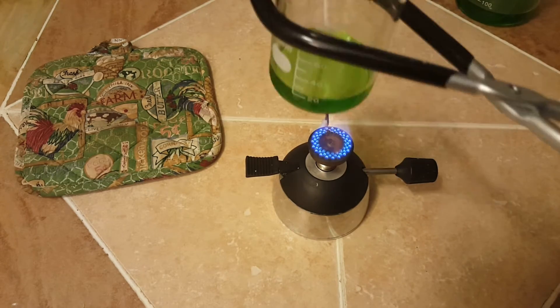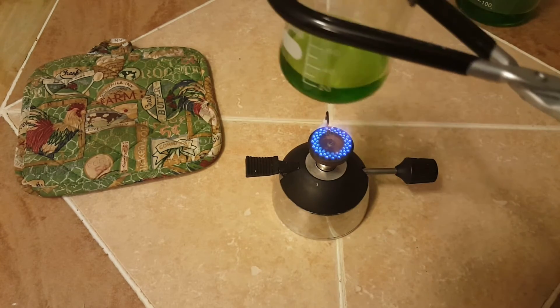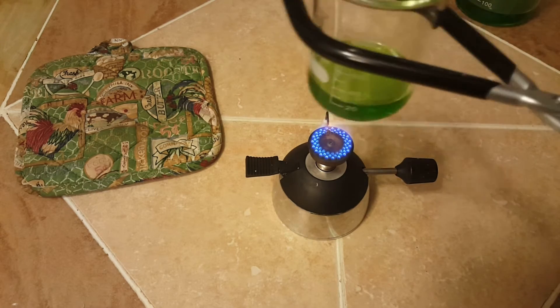You'll notice that in the video I heat in a circular pattern. This reduces the chance of the glass shattering from thermal shock and allows a much more even boil, meaning that it won't splash out.